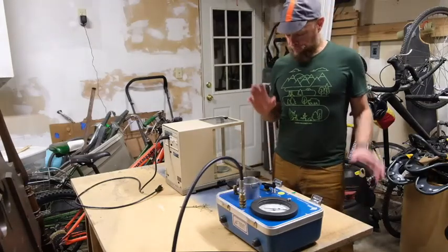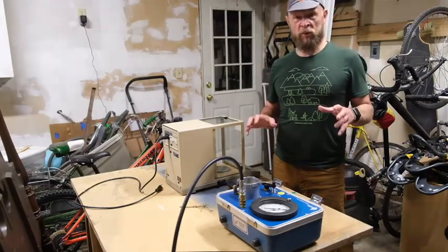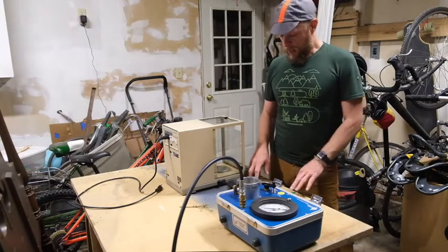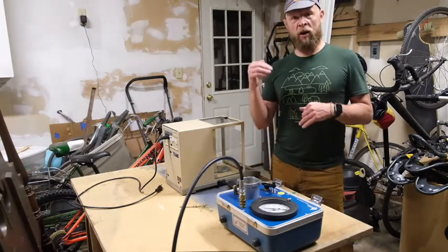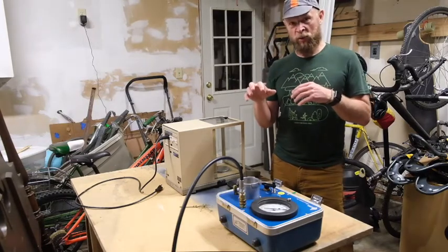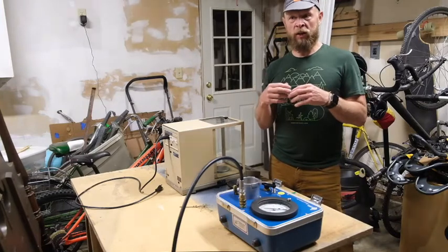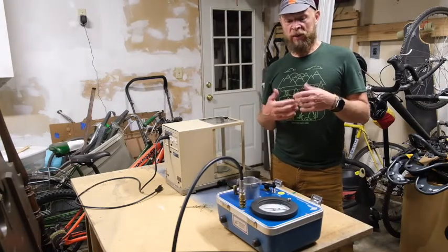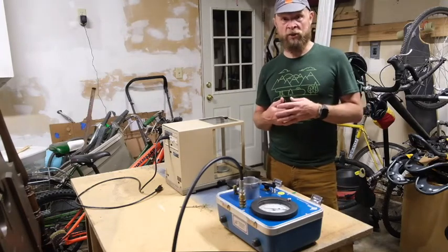Okay, I'm going to show you very briefly how I would go about measuring a pressure volume curve. And then in the next part of the video, I'll walk you through the theory of what's happening during a pressure volume curve and what parameters you can get from that curve that are meaningful in understanding how a plant would respond to drought.